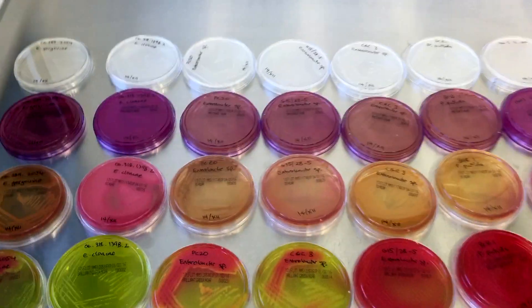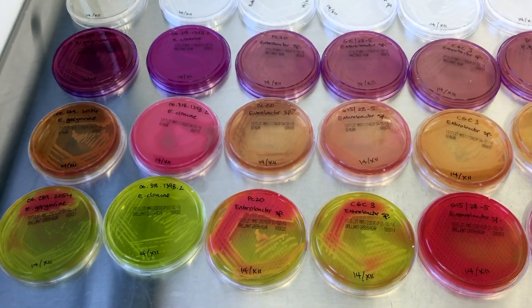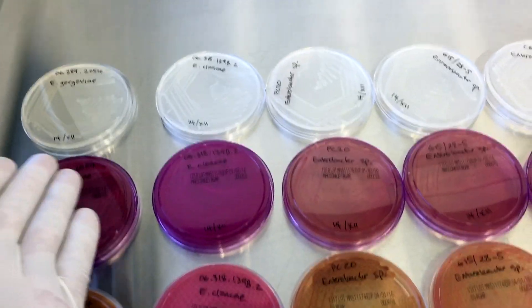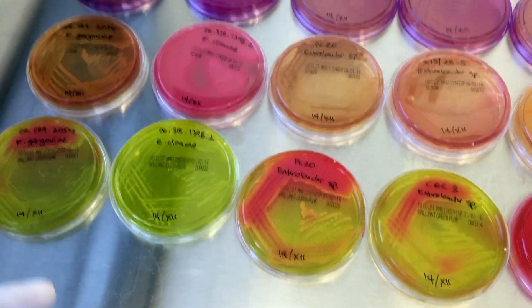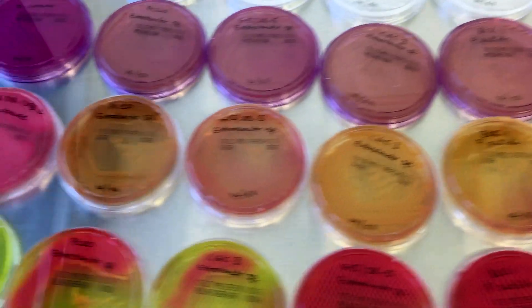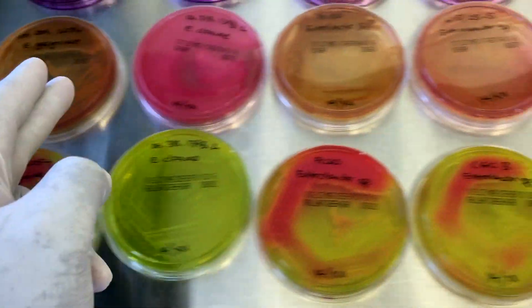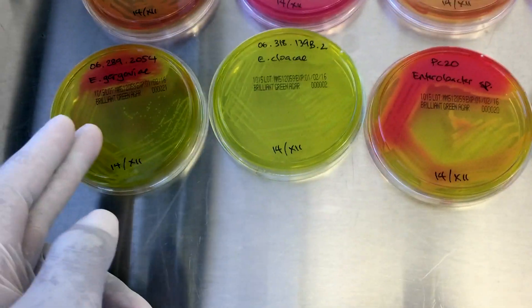Hi, this is a video about the different bacterial species and four different types of media. The first row of media is Enterobacter media, which I made myself. The other three I've purchased. This is MacConkey Agar with crystal violet — it's an inhibitor for certain types of bacteria. This is SS Agar. This is a brilliant green Agar.